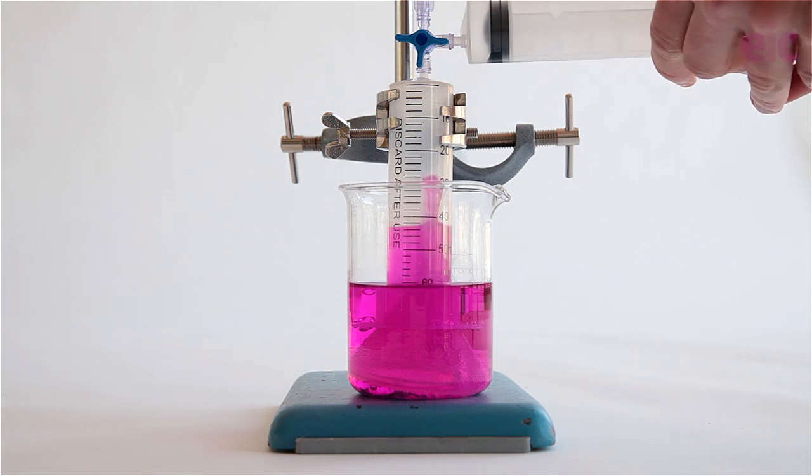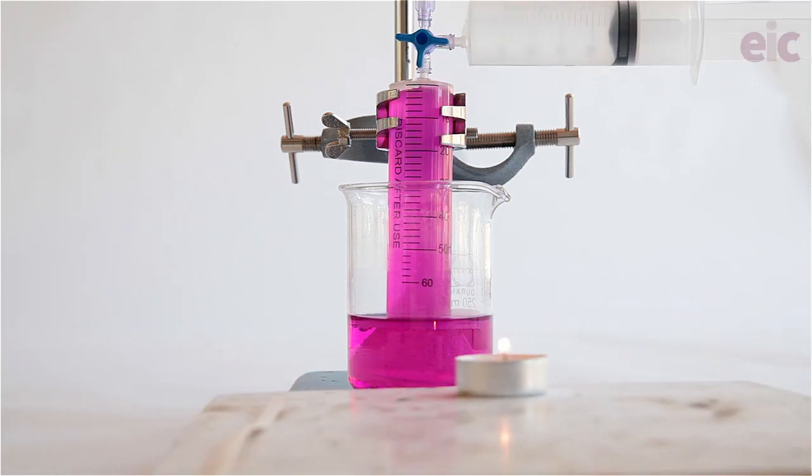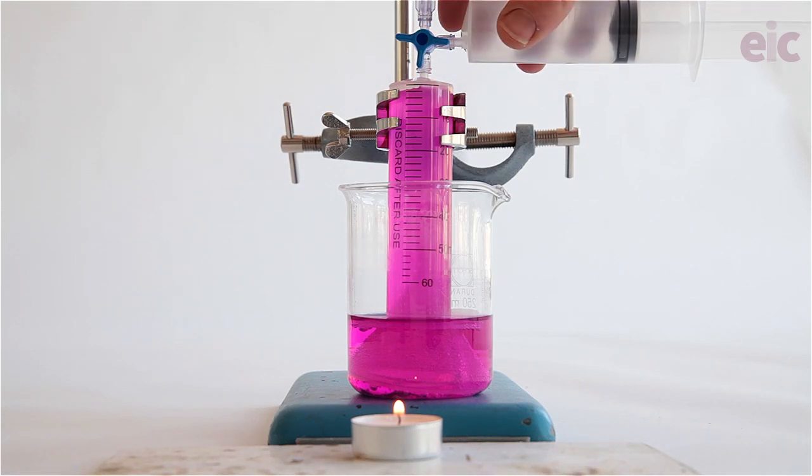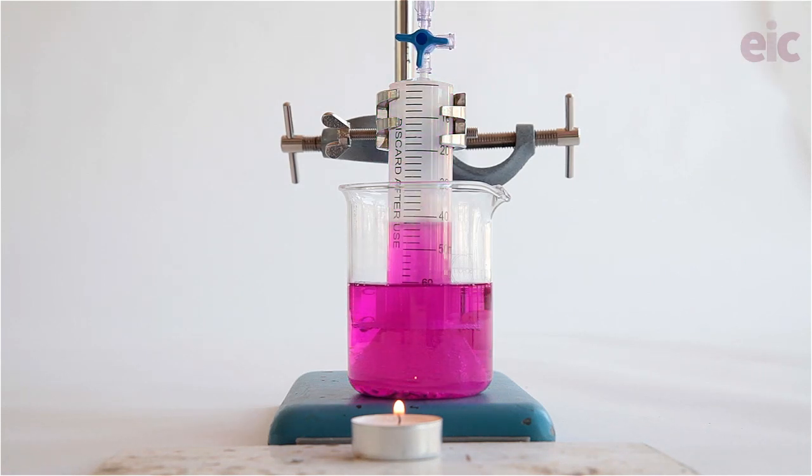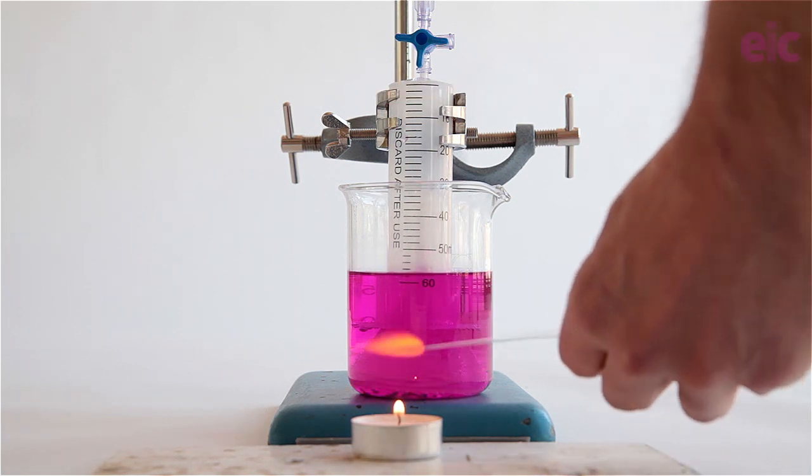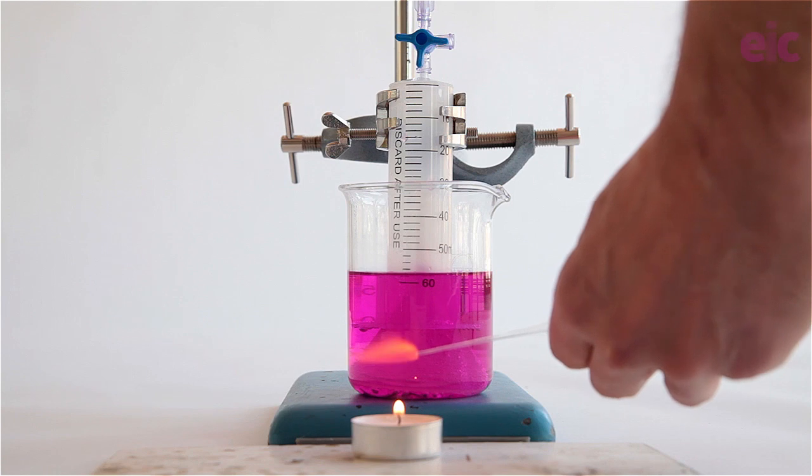But of course, when it comes to showing a reaction, you may not necessarily have the ability to immediately cut back the following day for some students, and this is where being able to speed things up by working at a higher temperature and reacting the magnesium with some steam can help us out.